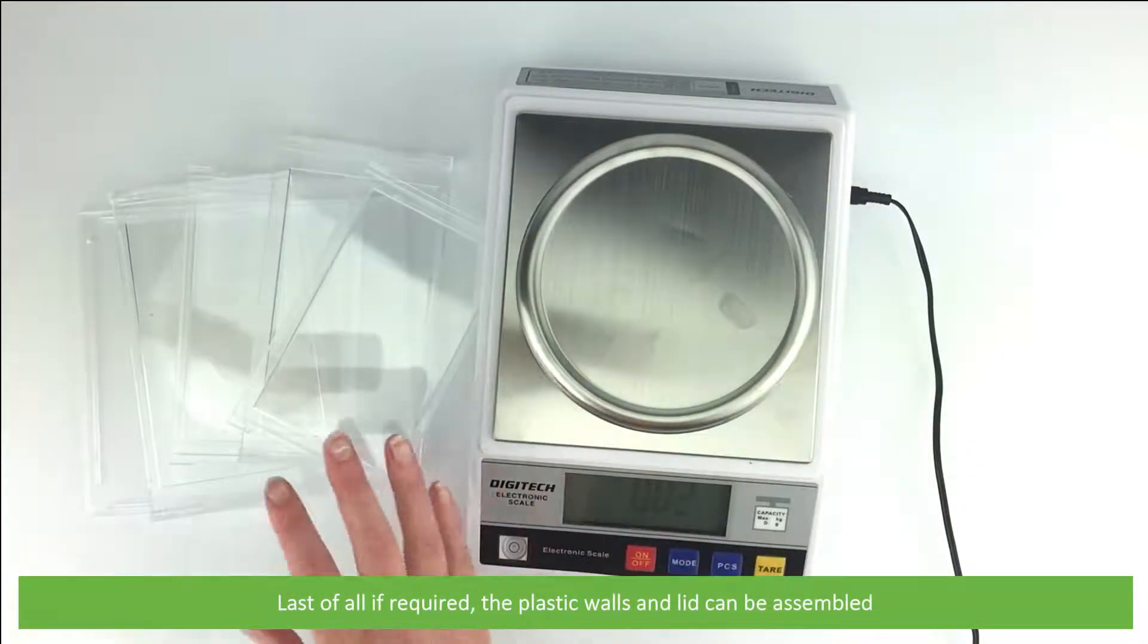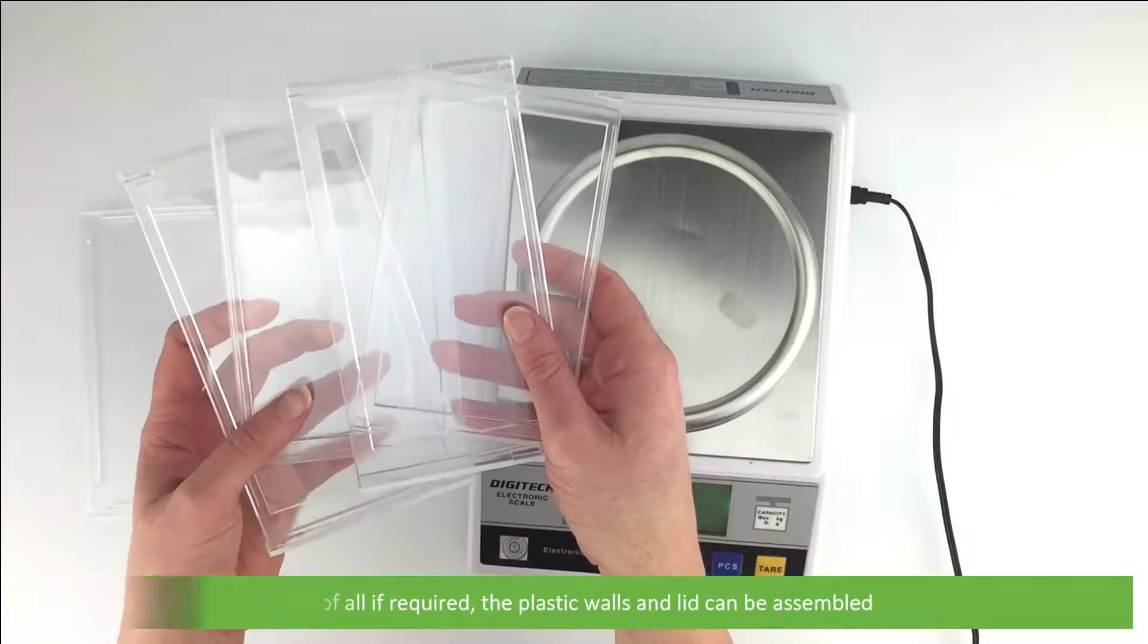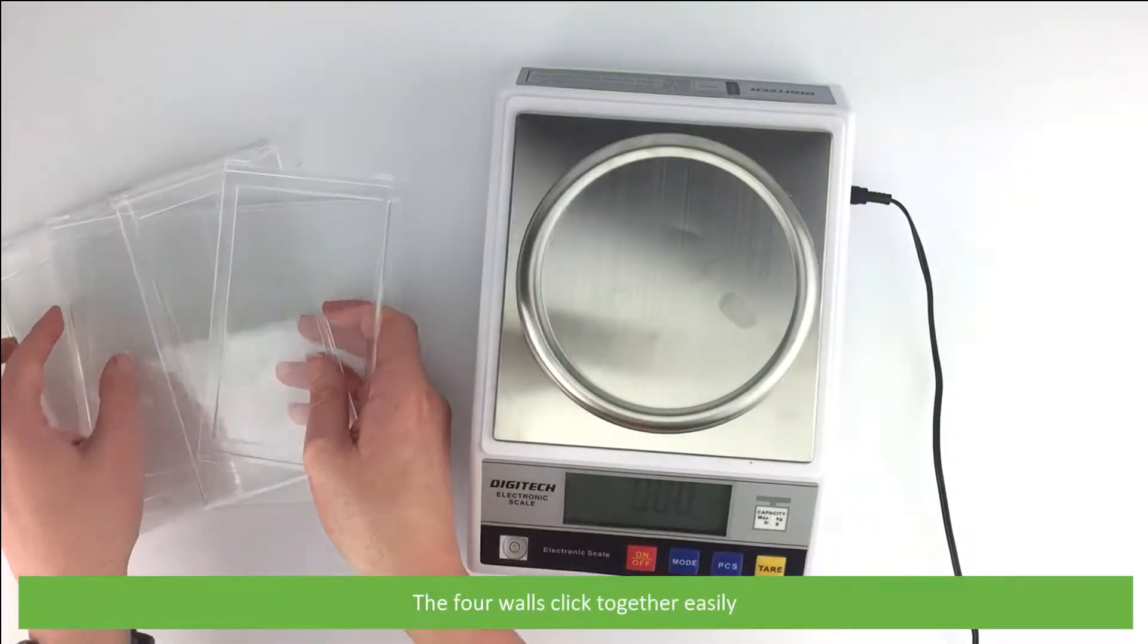Lastly, if required, the plastic walls and lid can be assembled. The four walls click together easily.